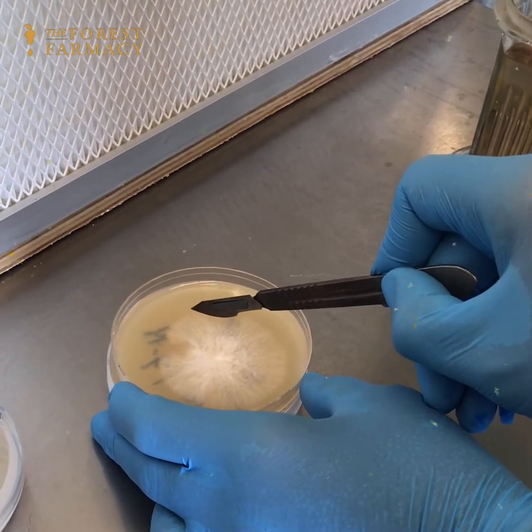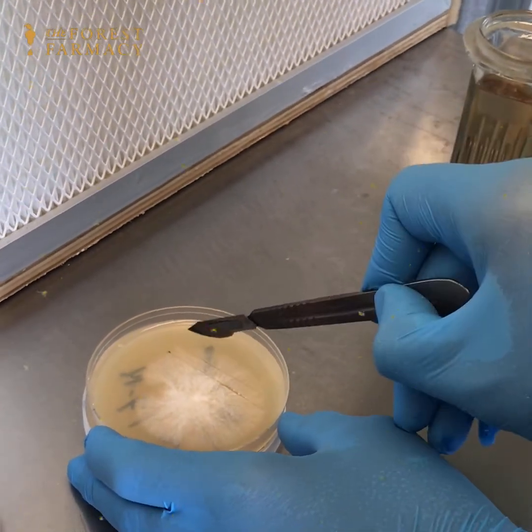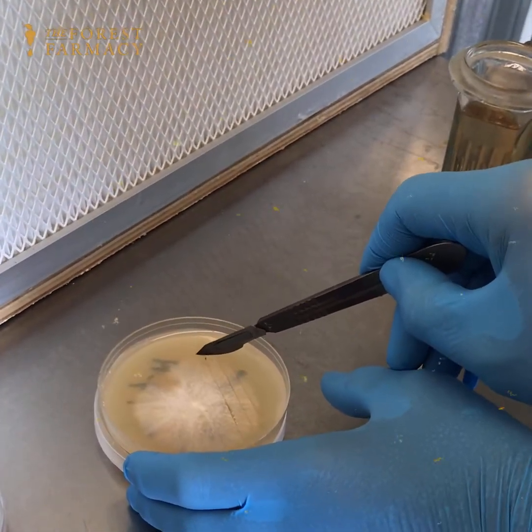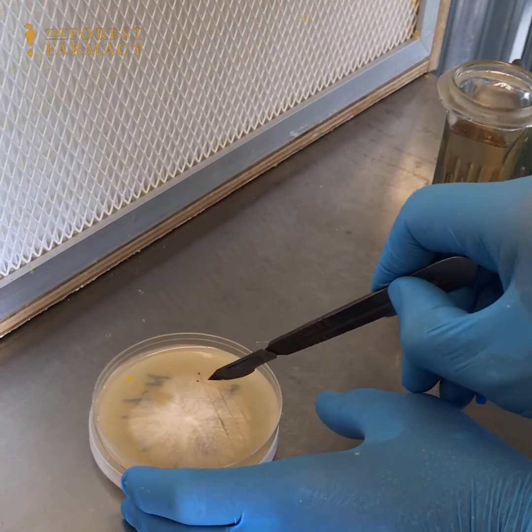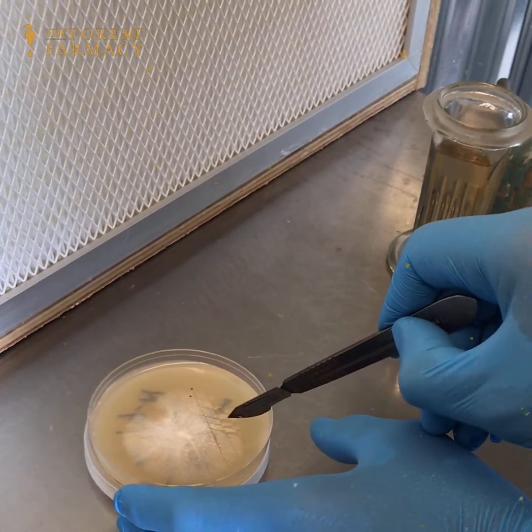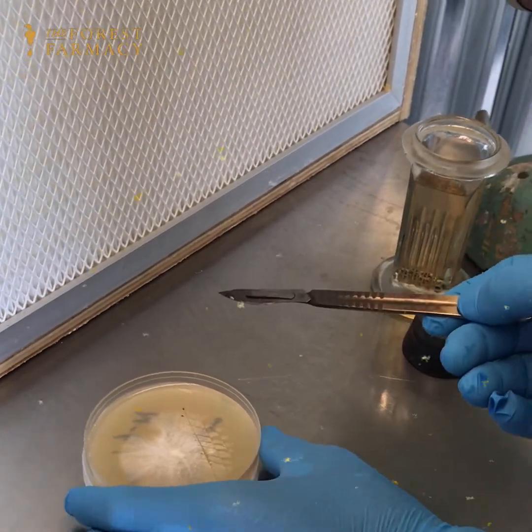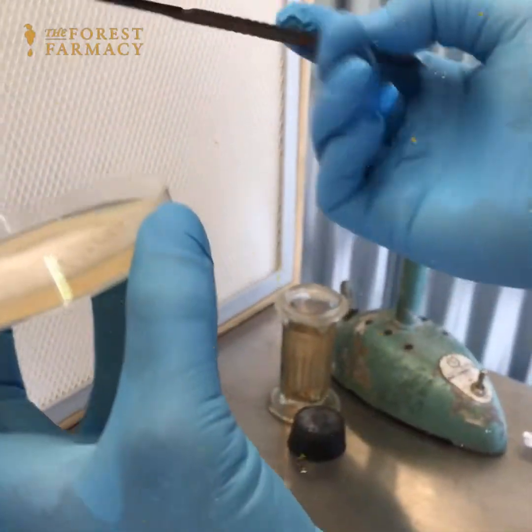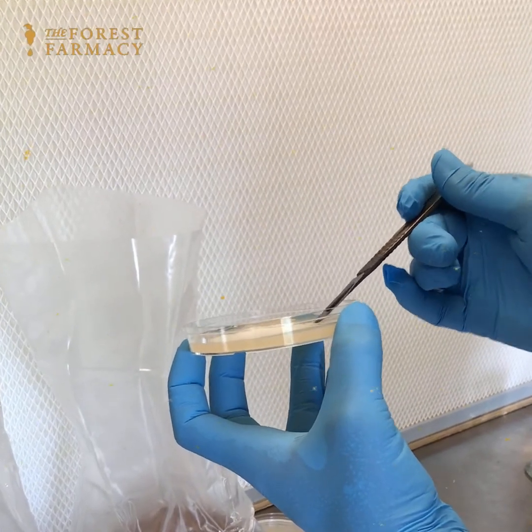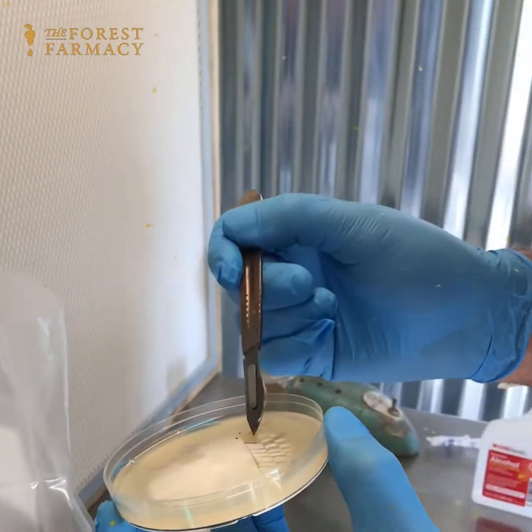The inoculation point is on the plate. I want to cut especially this leading edge because it's growing really fast — you want to ride that mycelial wave as much as possible. I cut it into wedges, and once the wedges are cut, don't worry — the scalpel pulls some mycelium off, and it still has mycelium on it even though you can't see it. I always tilt it towards the hood so the airflow blows everything off.